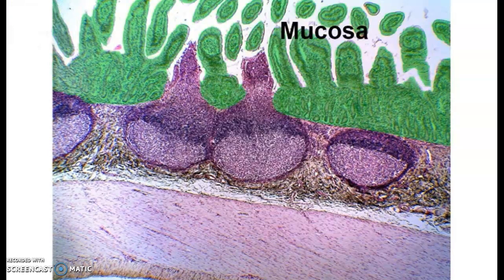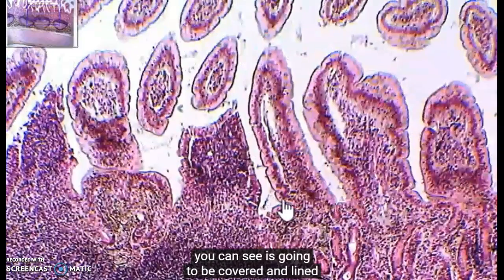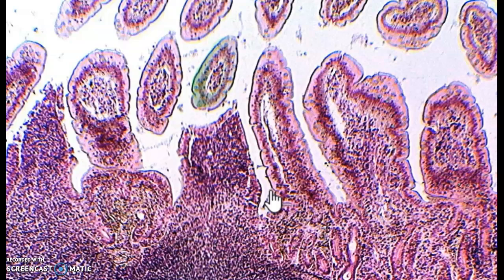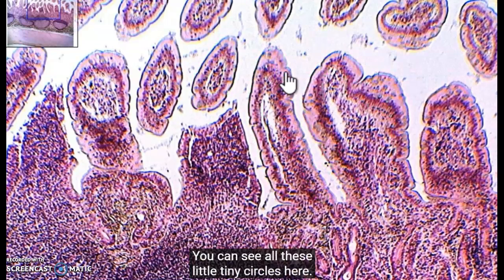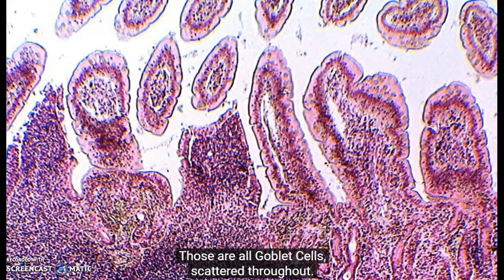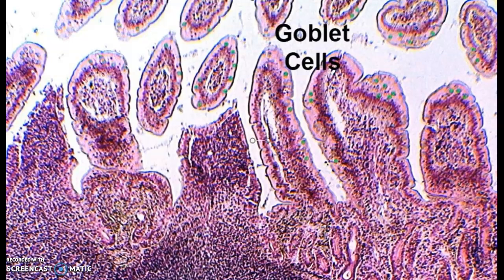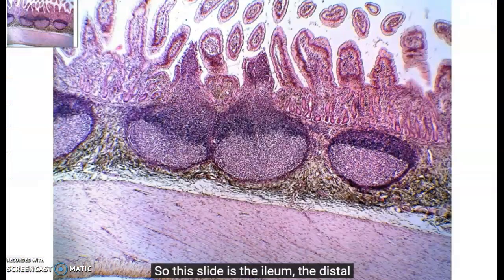If we zoom in a little bit after that, we are able to see the simple columnar epithelium, which is for absorption. And you can see these little tiny circles here, the goblet cells. Remember, that's for production of mucus. And so this slide is for the ileum.